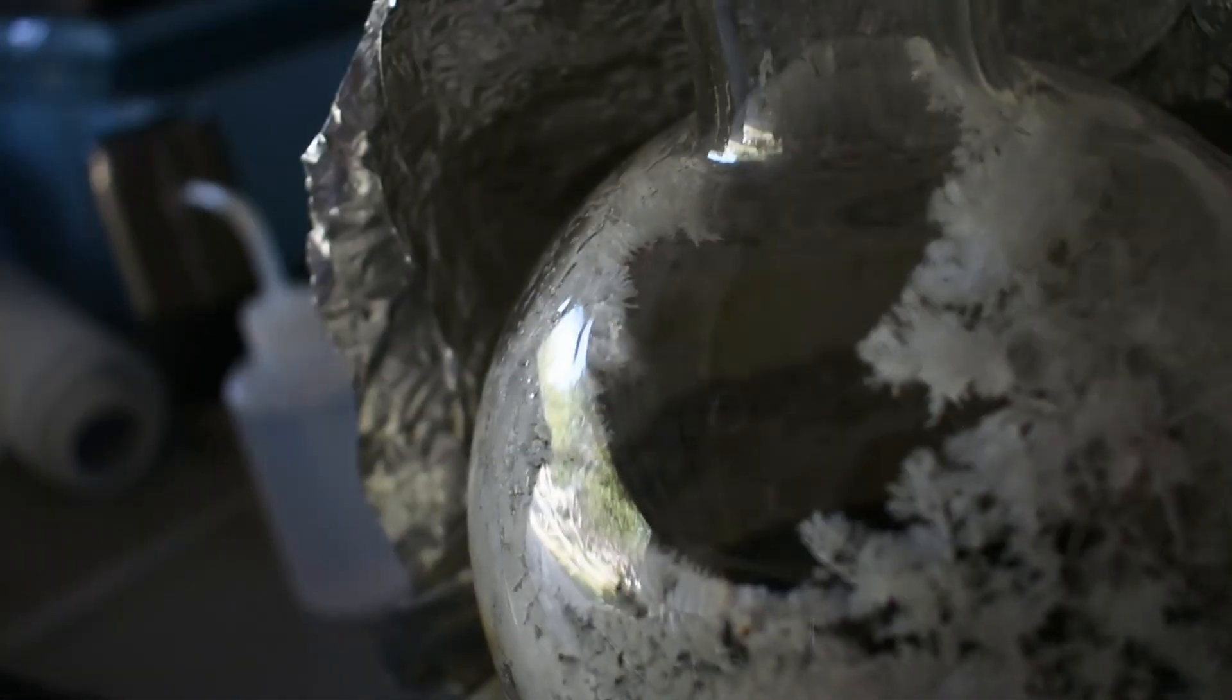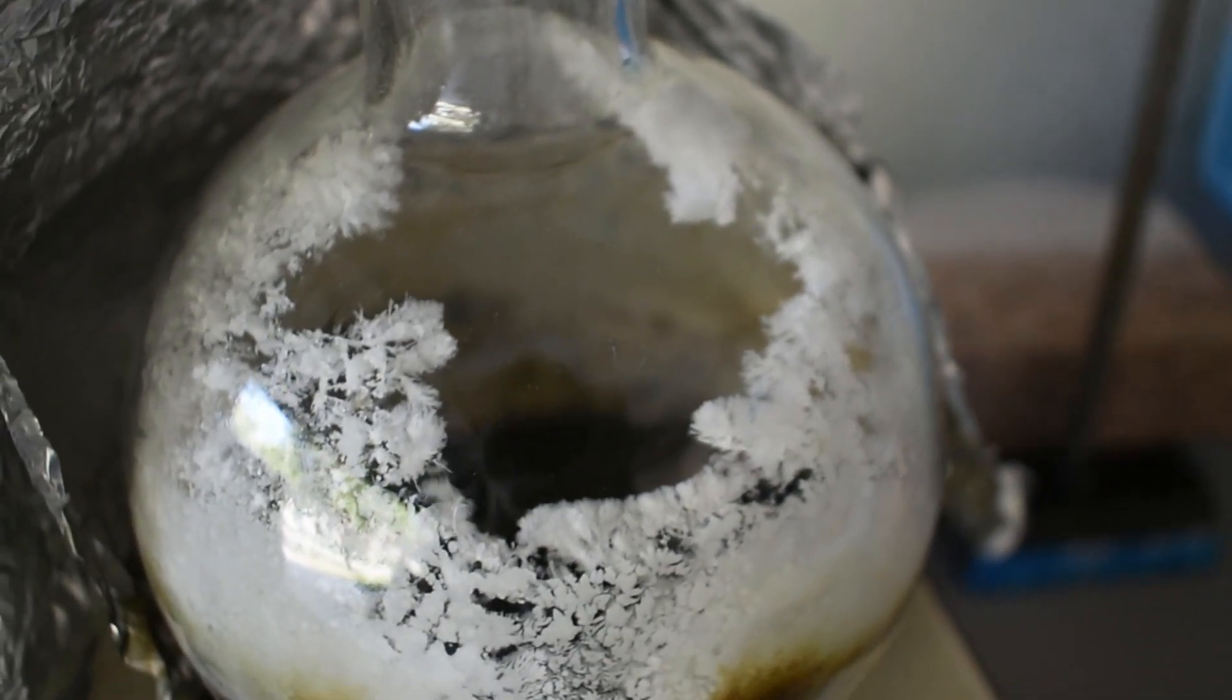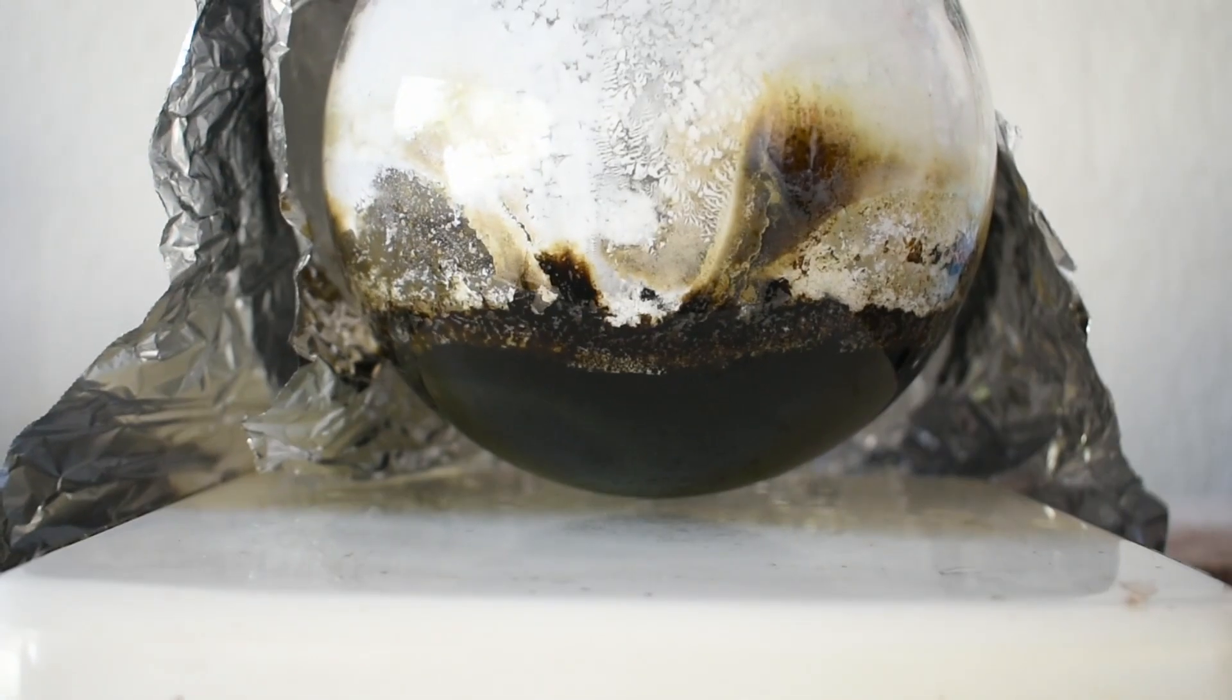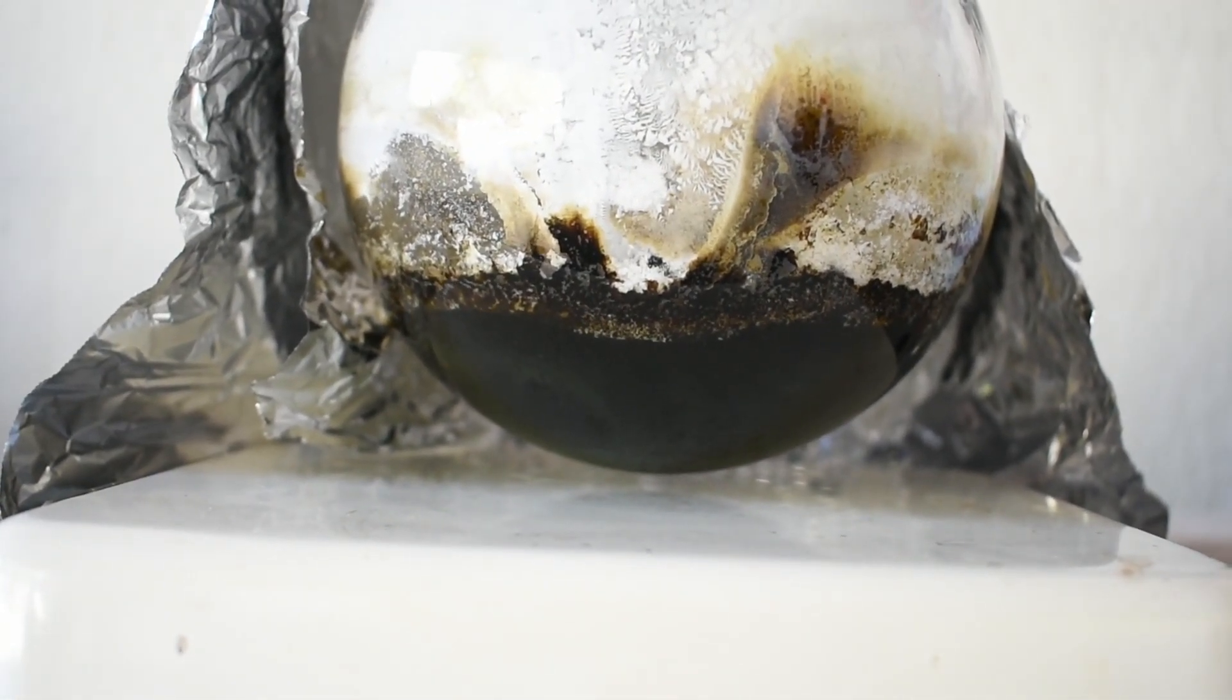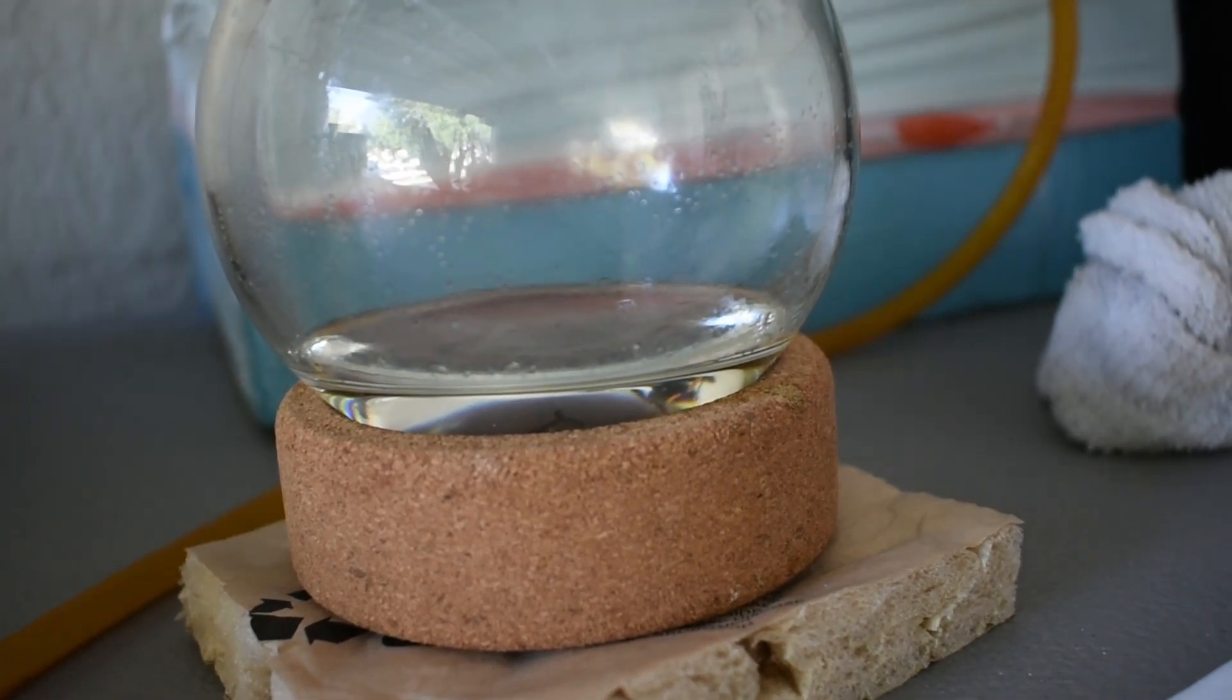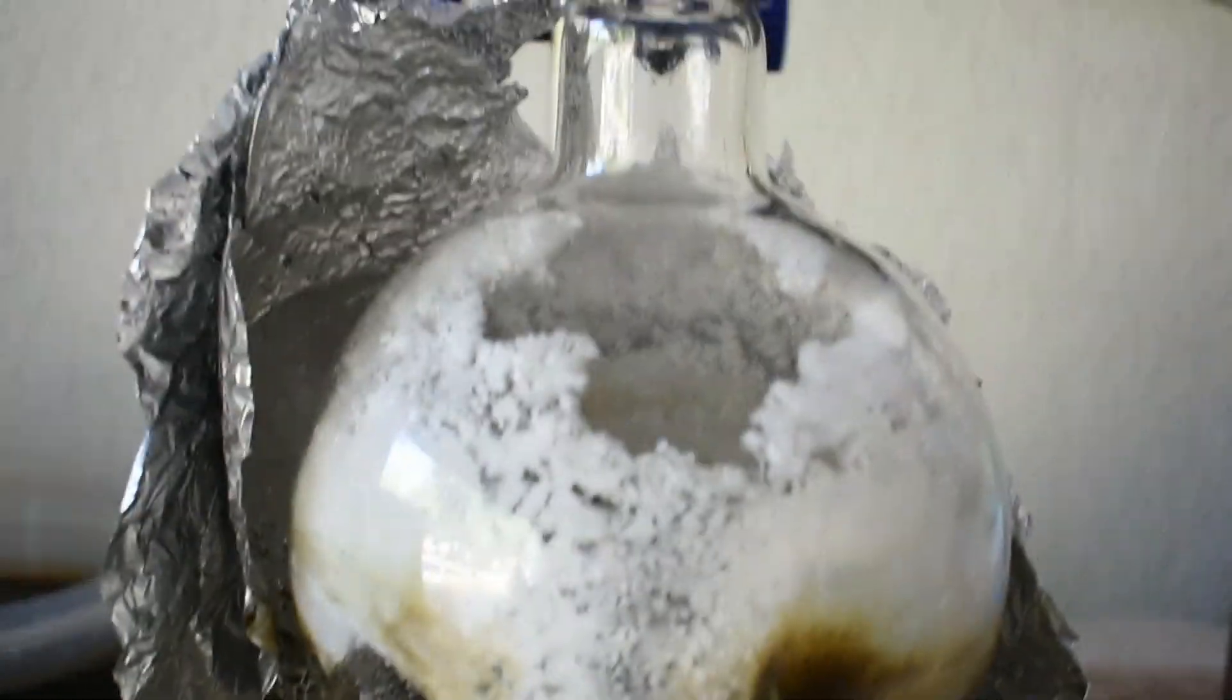Distillation's coming close to an end. There's some really nice, almost snow-like crystals forming on the walls of the flask. You can see it's actually sort of like snow. The crystals fall in every once in a while from the pyridine dripping, refluxing in the flask. It's pretty nice. This is the volume of liquid I have left. It's very dark black liquid. Chromium waste. Be careful with this. But on the receiver, we have some quite pure pyridine. There's most certainly some niacin contamination, but we're going to re-distill it anyway. We'll get rid of that contamination.